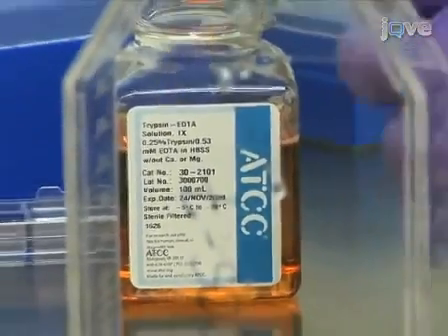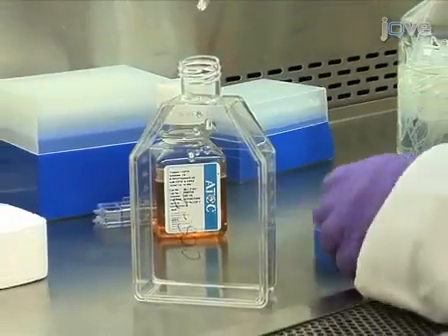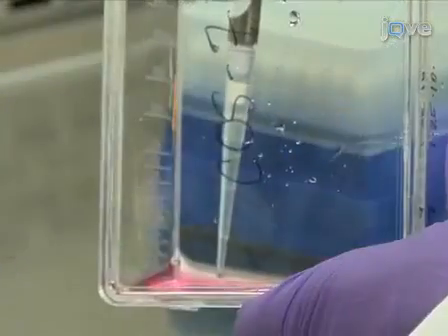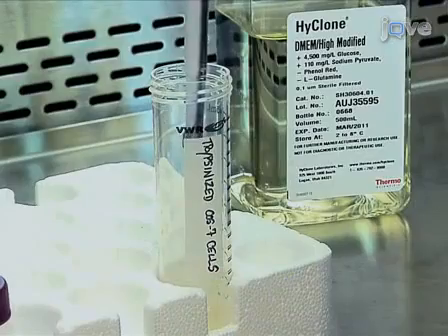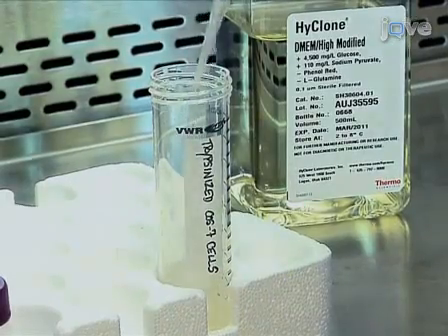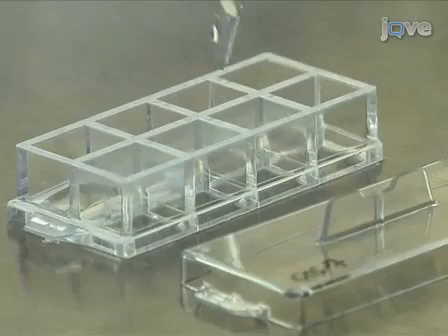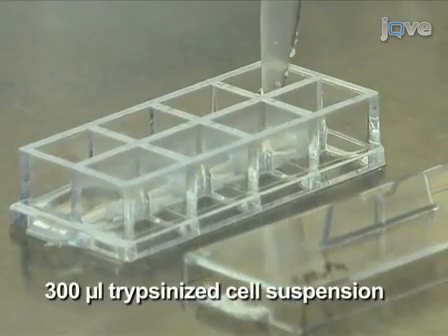To prepare COS7 cells for transfection, trypsinize them according to standard protocols, and add 50 to 100 microliters of cells to 6 milliliters of complete DMEM medium. Mix the cell suspension by pipetting up and down several times, then aliquot 300 microliters of trypsinized cell suspension to each well.